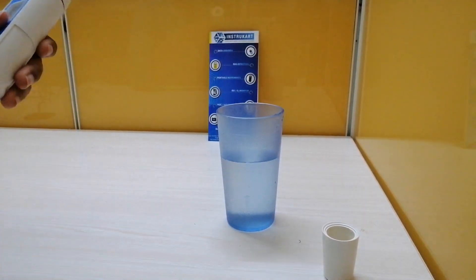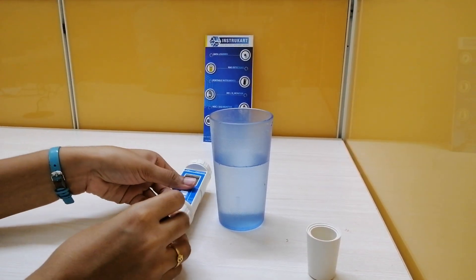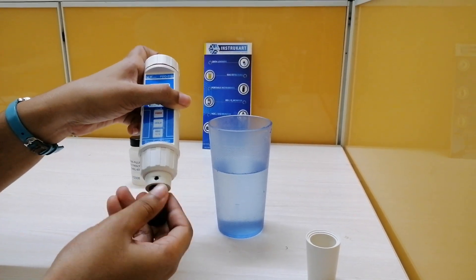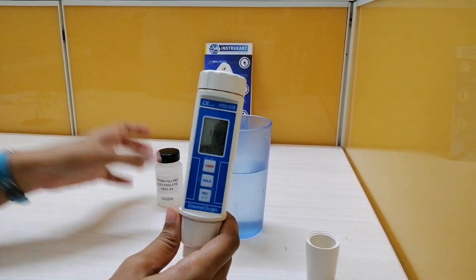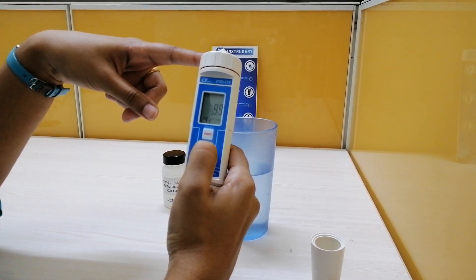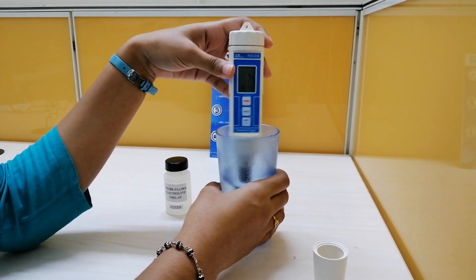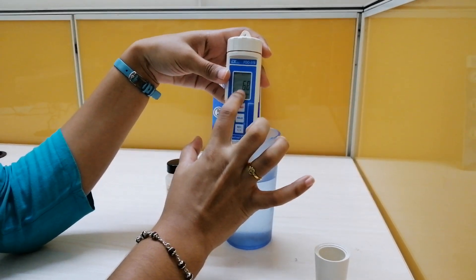Let me check with a glass of water. Take the electrolyte — here is the electrolyte. You have to fill a drop of electrolyte into the probe cap. I have already filled it with the electrolyte so I am not doing it right now. A long press of the hold key will give you the value of dissolved oxygen. Let me place this in the water and stir it.